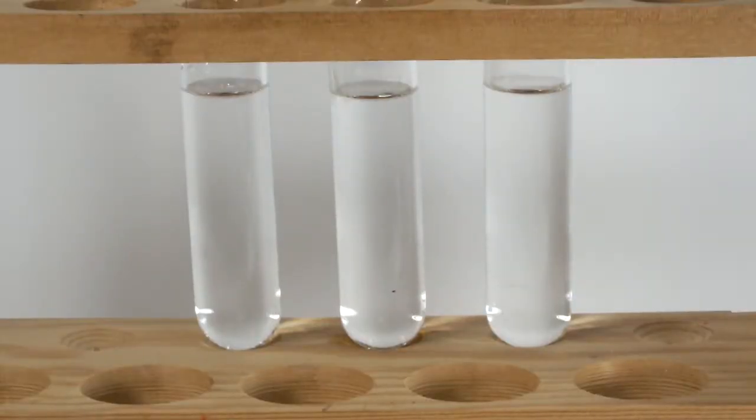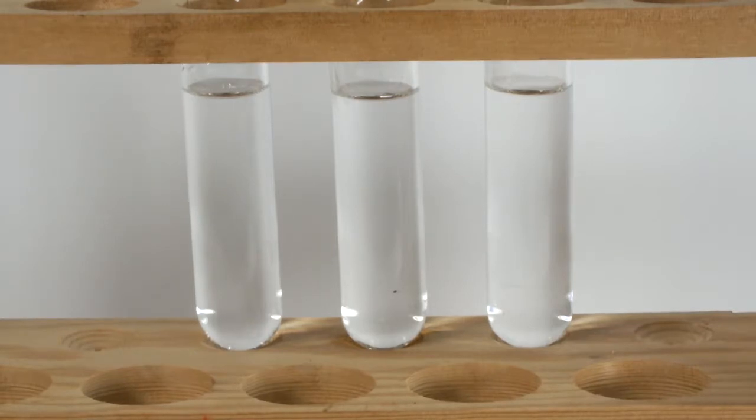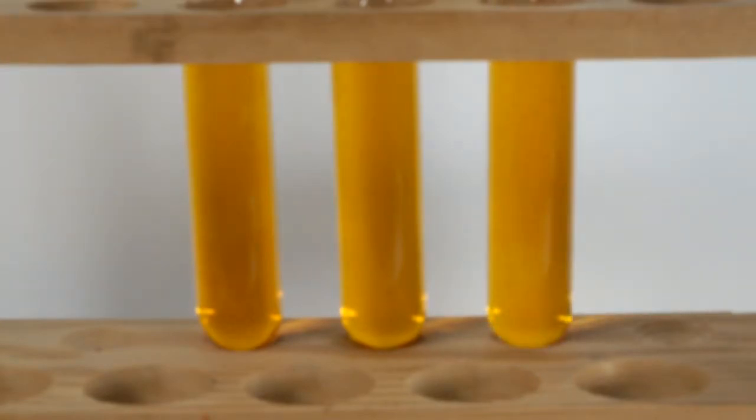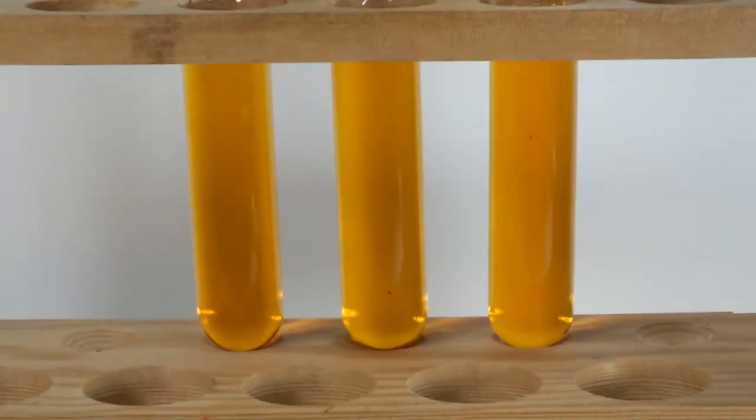Okay, enough about all that. I have here three out-of-focus test tubes, each containing 10 milliliters of distilled water. To each, I'm adding a pipette full of the freshly prepared methyl red solution. It's about a milliliter and a half.